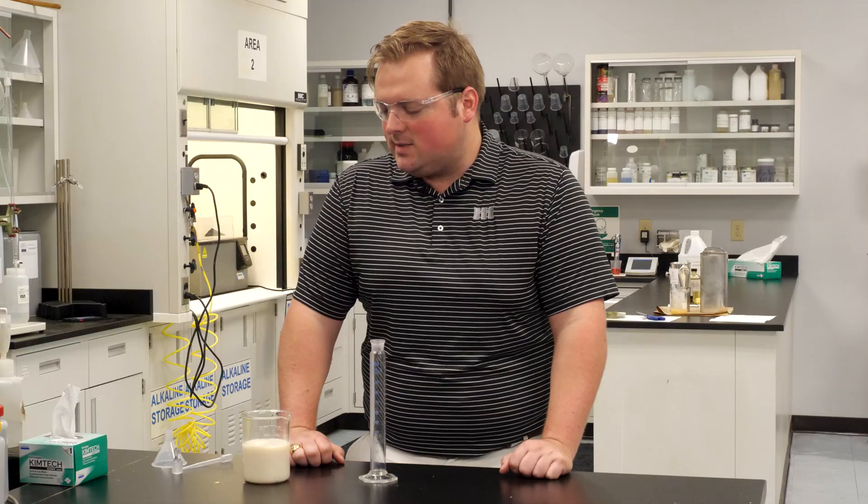Today we're going to be performing an oil solubility test. Anytime you're working with a product that is a water-soluble oil, one of the controls you need to do to determine the titration would be to do an acid split test.